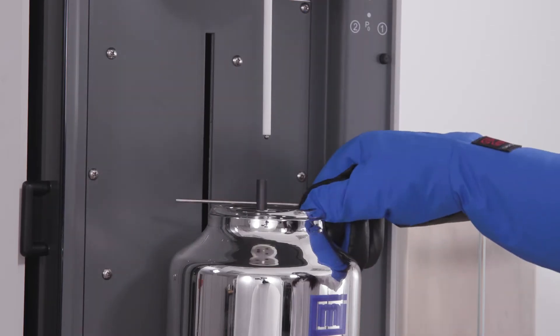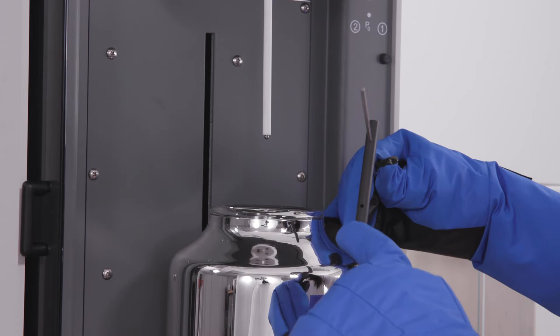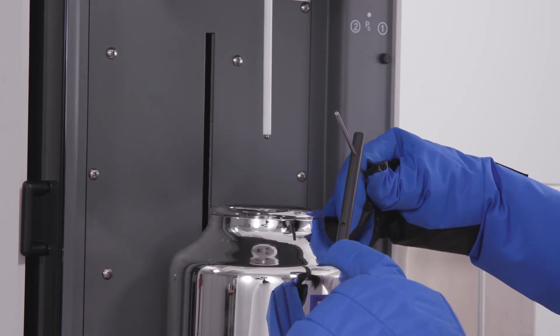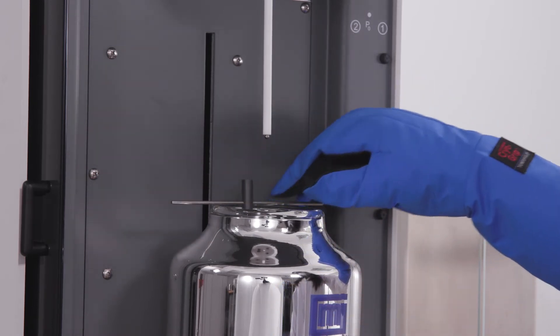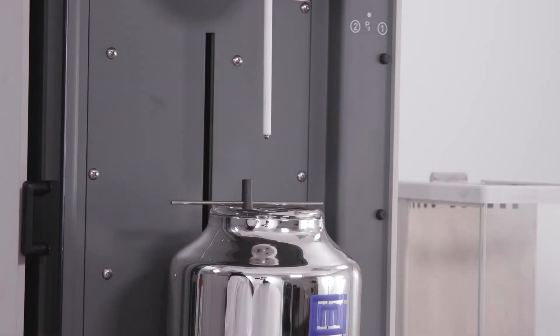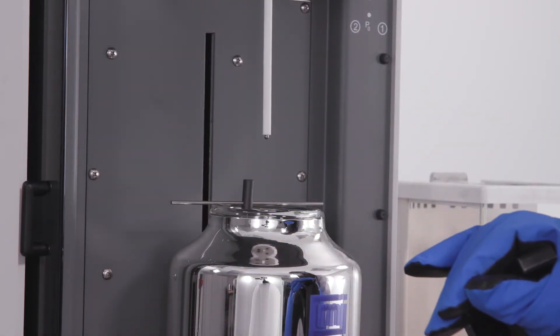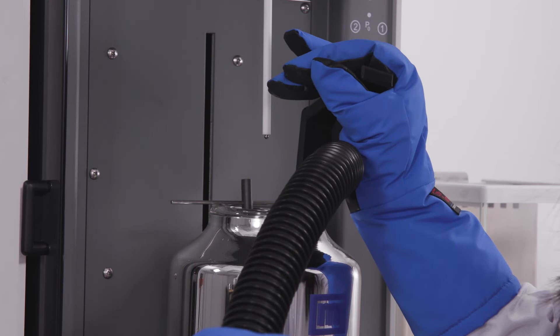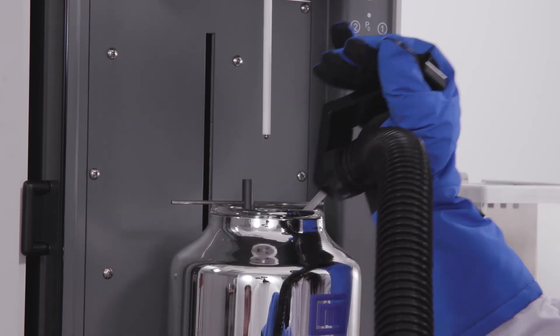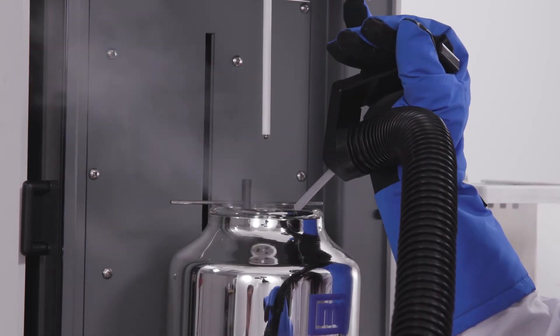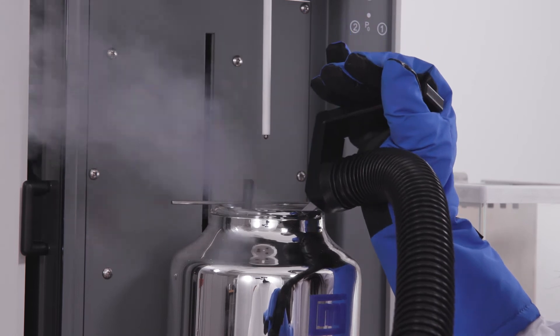Place the dipstick on the opening of the dewar to use as guidance for the cryogenic liquid level. Fill the dewar to the circle on the dipstick with liquid nitrogen wearing appropriate personal protective equipment. The optional liquid nitrogen transfer system provides an easy and efficient way to fill the dewar with the dewar in place on the TriStar elevator platform. This helps to eliminate moving a filled dewar.